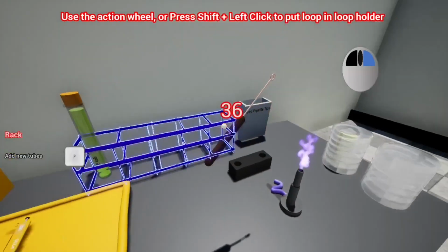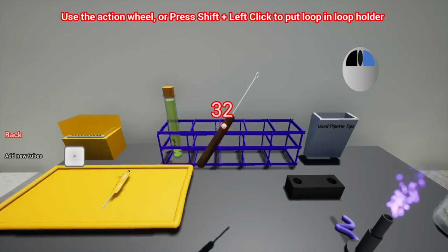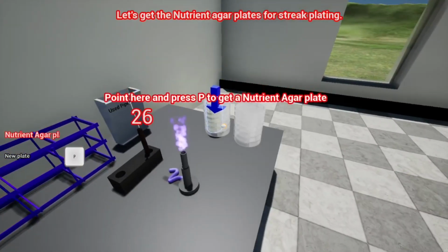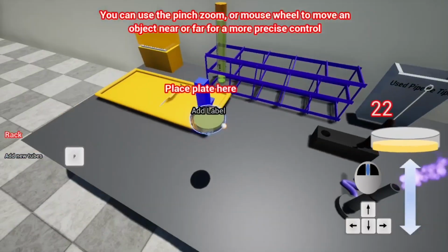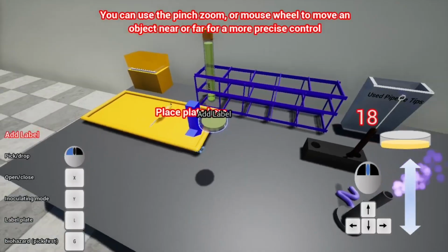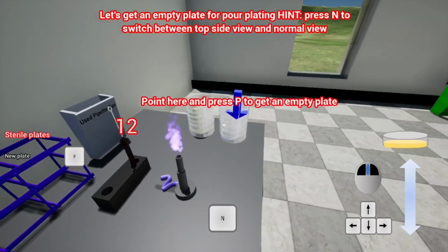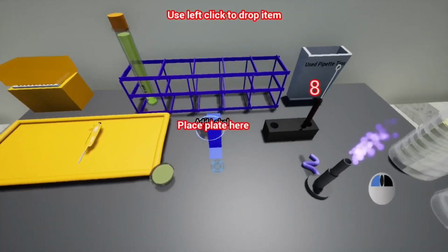Use the action wheel, or press Shift plus left click to put loop in loop holder. Okay, I'm gonna do Shift and click. There we go. Let's get the nutrient agar plates for streak plating. Okay. Press P. Pick up the plate. Pinch zoom or mouse wheel to move an object near or far for more precise control. You can use pinch zoom and place it over here. Let's get an empty plate for pour plating. Okay, let's get an empty plate for pour plating, and there we go.